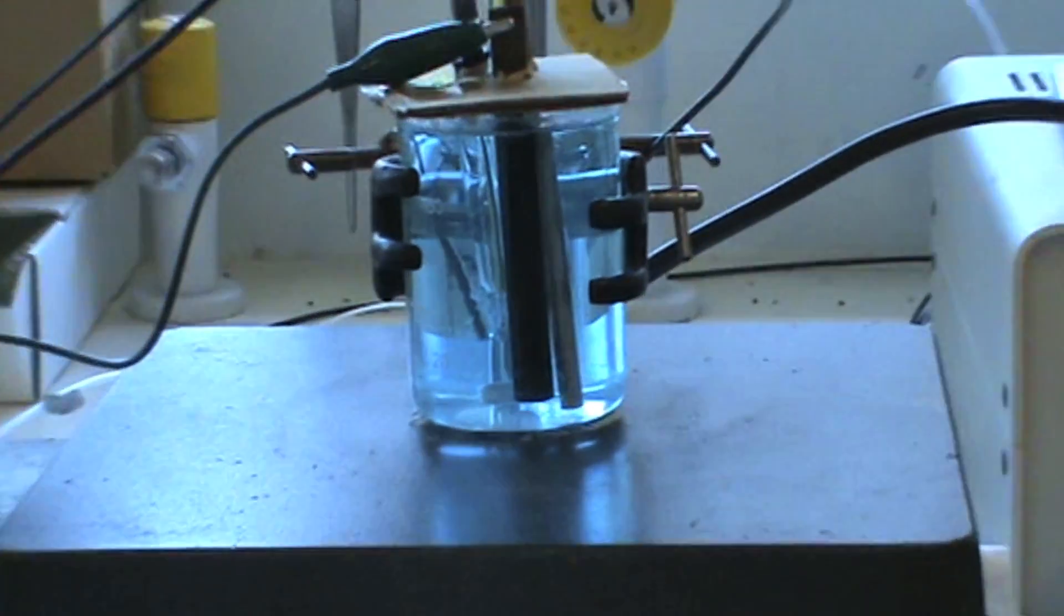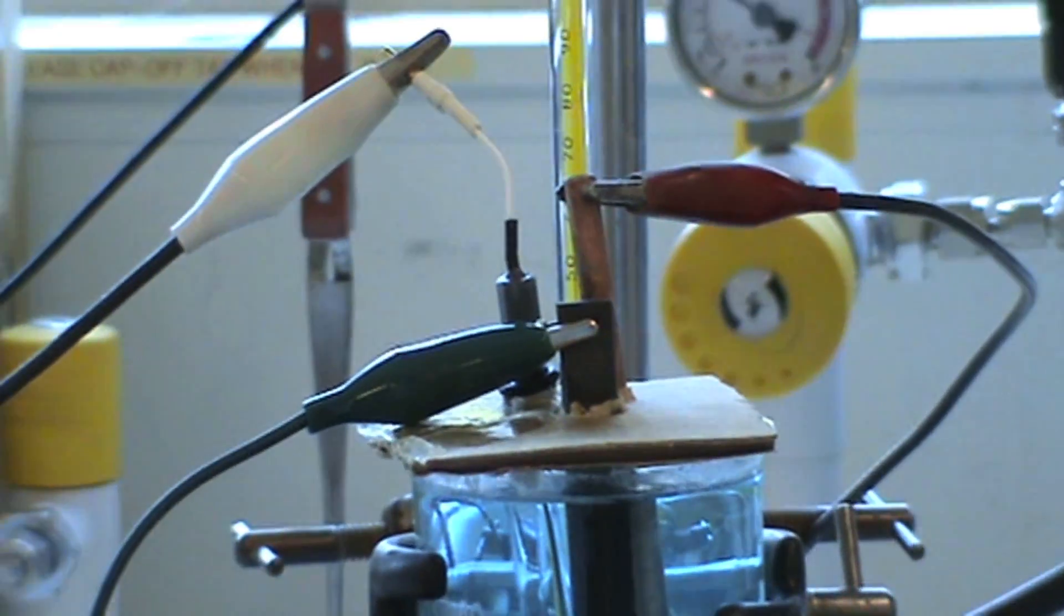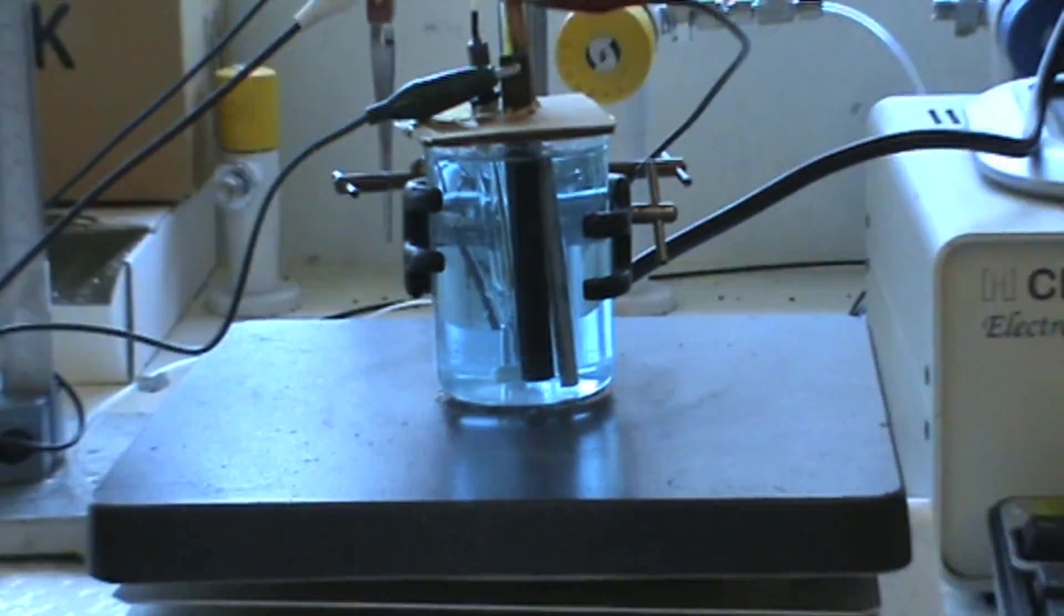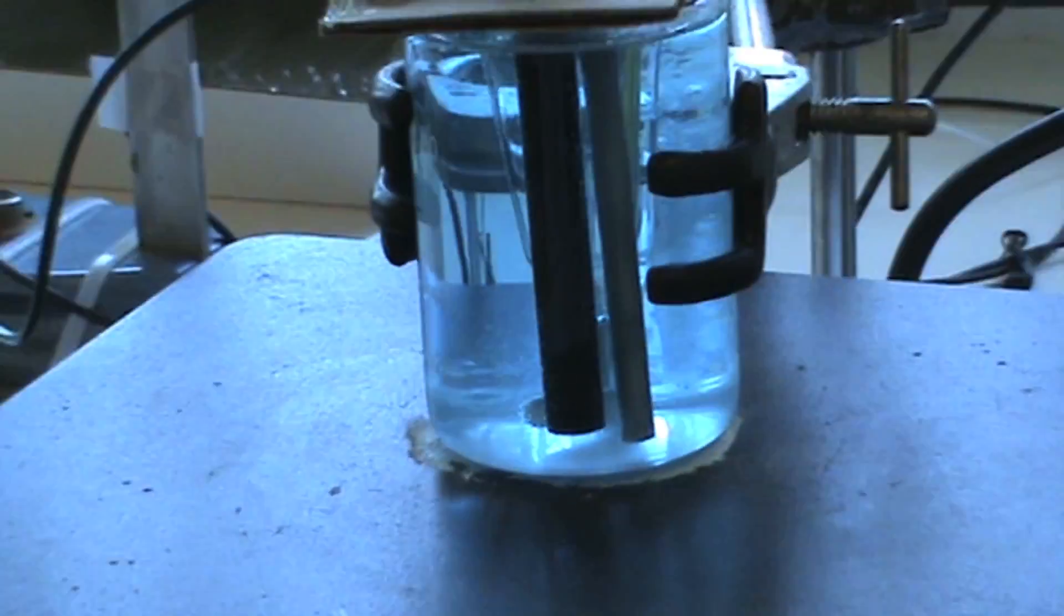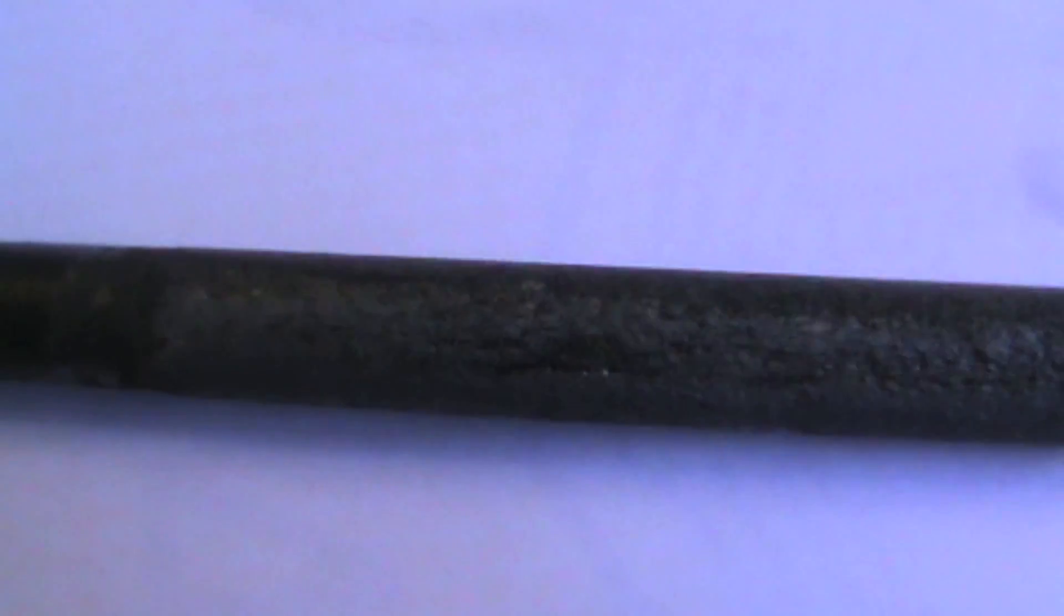Welcome, TDC viewers. In this video, I will be electrodepositing lead dioxide onto graphite under the influence of hexadecyl trimethyl ammonium bromide (CTAB), a cationic surfactant. It has been found that the addition of a surfactant gives a smooth and adherent deposit, free from pinholes under stationary conditions.